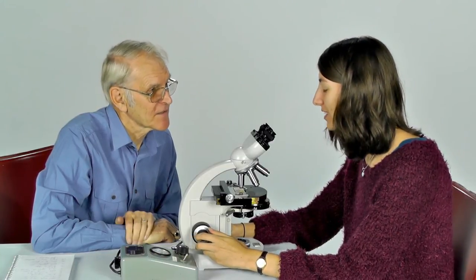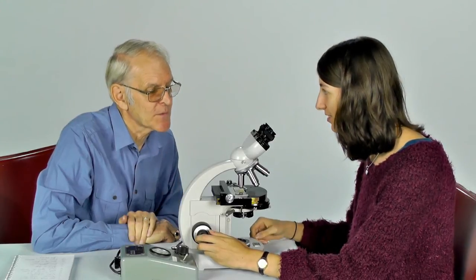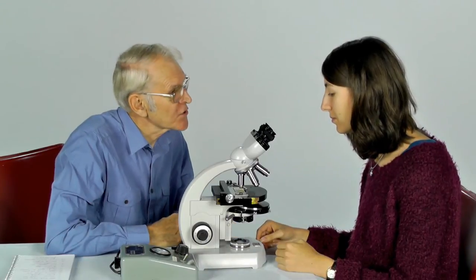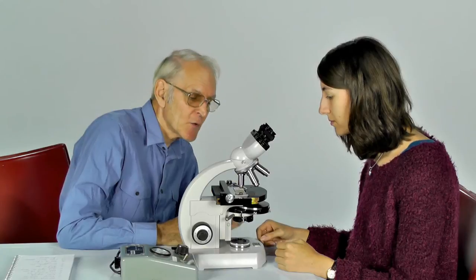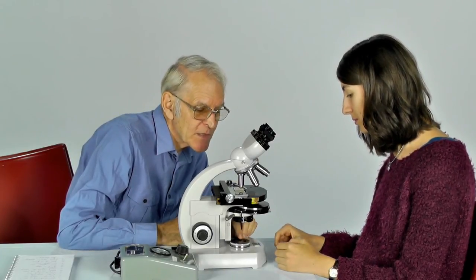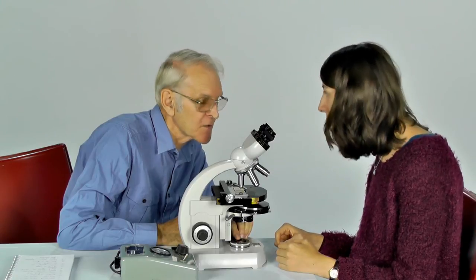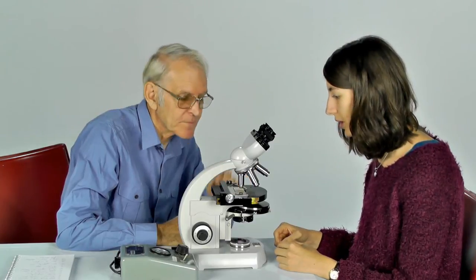So now you have an image. That's a lot of what we have to achieve. We're going to try to refine this image now that you've seen. In order to do that, we want to ensure that the patch of light that's coming from the base of the microscope is superimposed on the specimen.